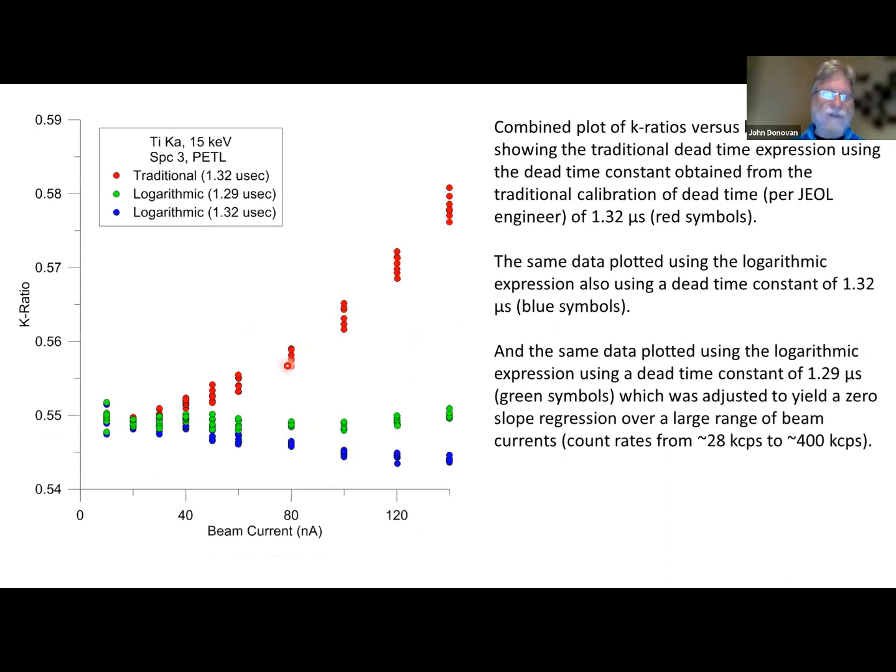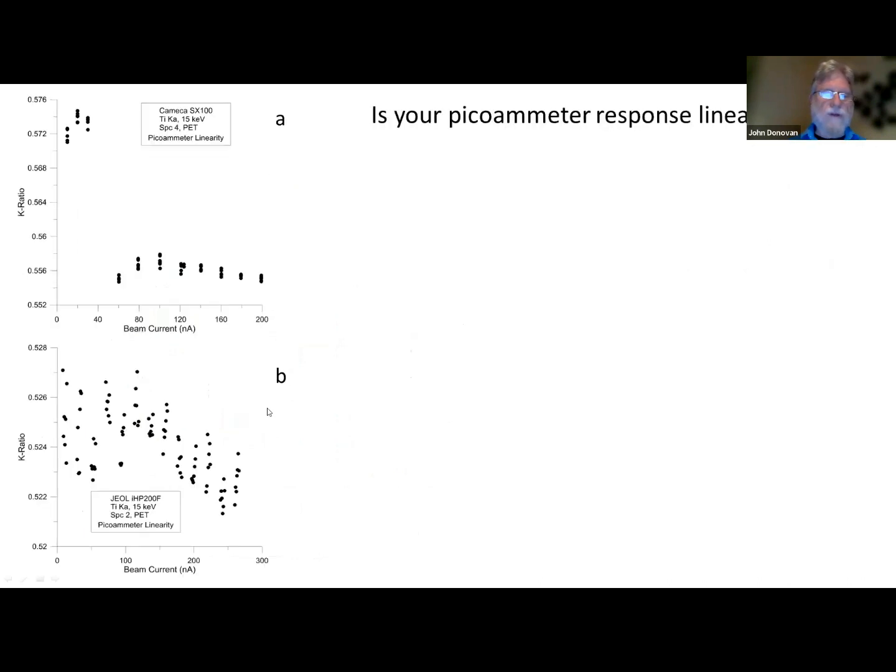Here's the linear expression calibrated using the JEOL engineer value. Here, the blue is using the logarithmic expression with the original dead time constant. And then here we just tweaked that dead time constant a little bit to get a constant K ratio. Constant K ratio just means a zero slope line. All right, and at low count rates, the models all agree.